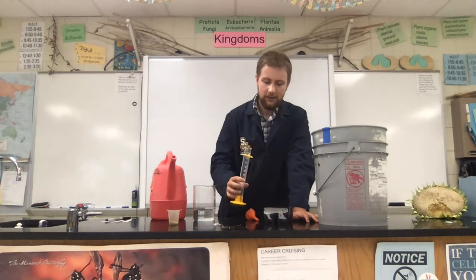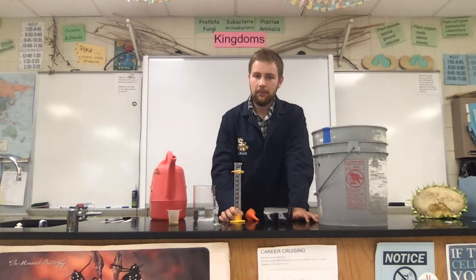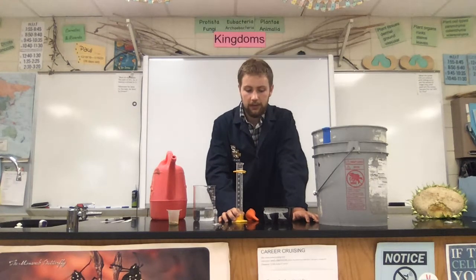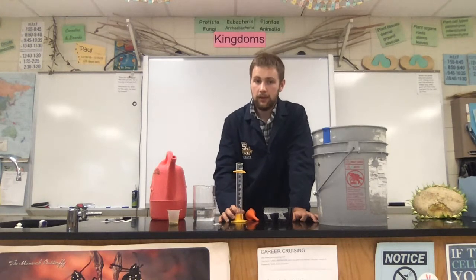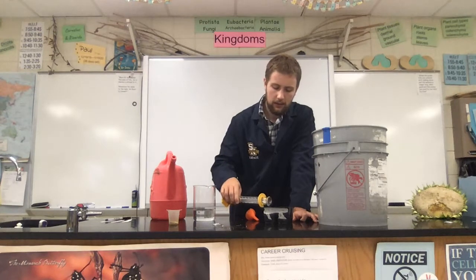All right. I feel like we're flooding these seeds, but I would say 50 mils is probably on the higher end of water that you would want to go. You'd probably only want to go 10 to 20, but for sake of experiment. Water is the only resource that seeds need to germinate, so these are not going to be kept in the light until hopefully they do germinate. So let's go ahead and keep adding water.